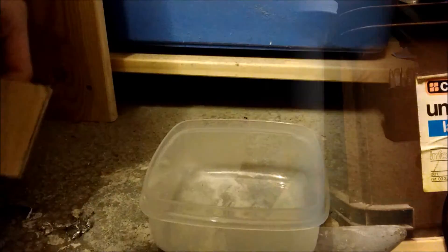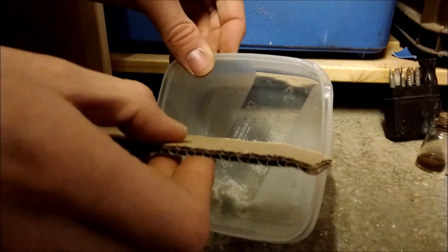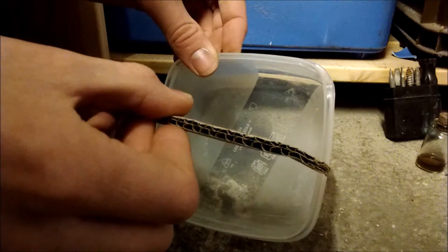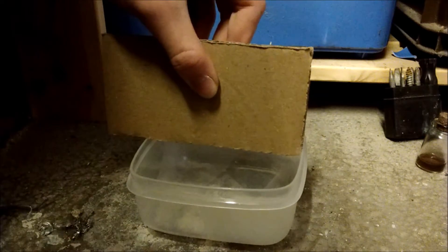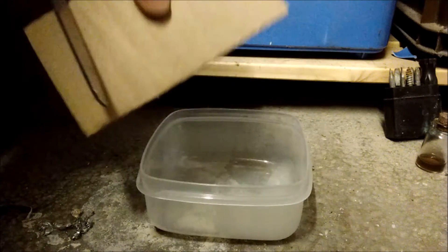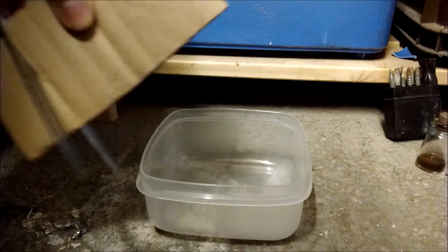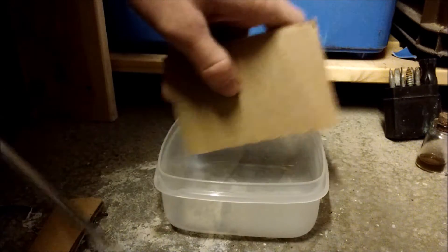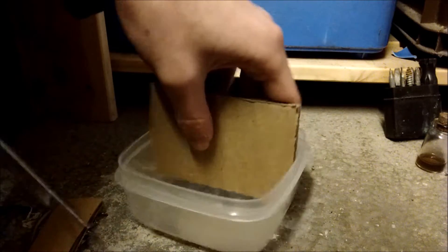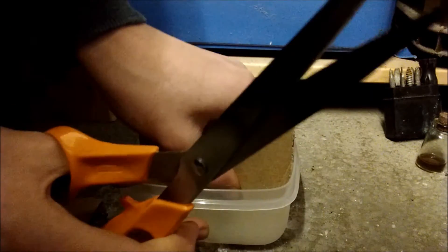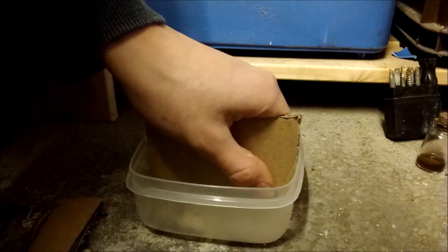If you want to do it, what you want to do is you want to divide the area in this roughly in two and put a dividing piece of cardboard into the mixture. So, you need to roughly work out how long it needs to be, put it right there, get it till it just about fits in, you want this to be fairly sealing, so it just goes in there, fits rather well.